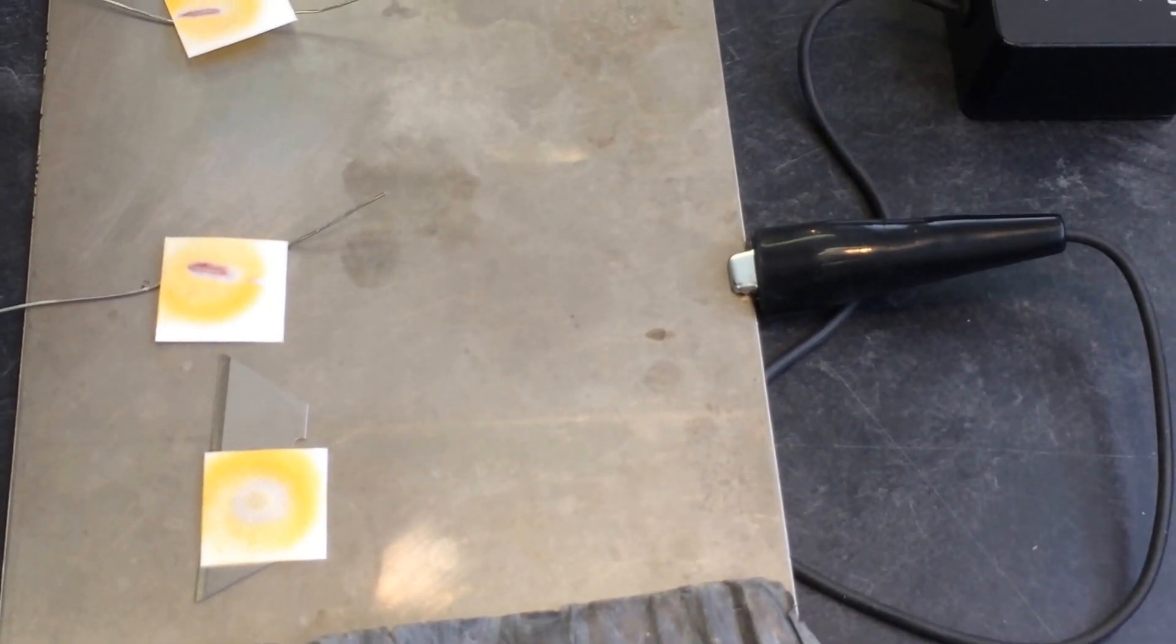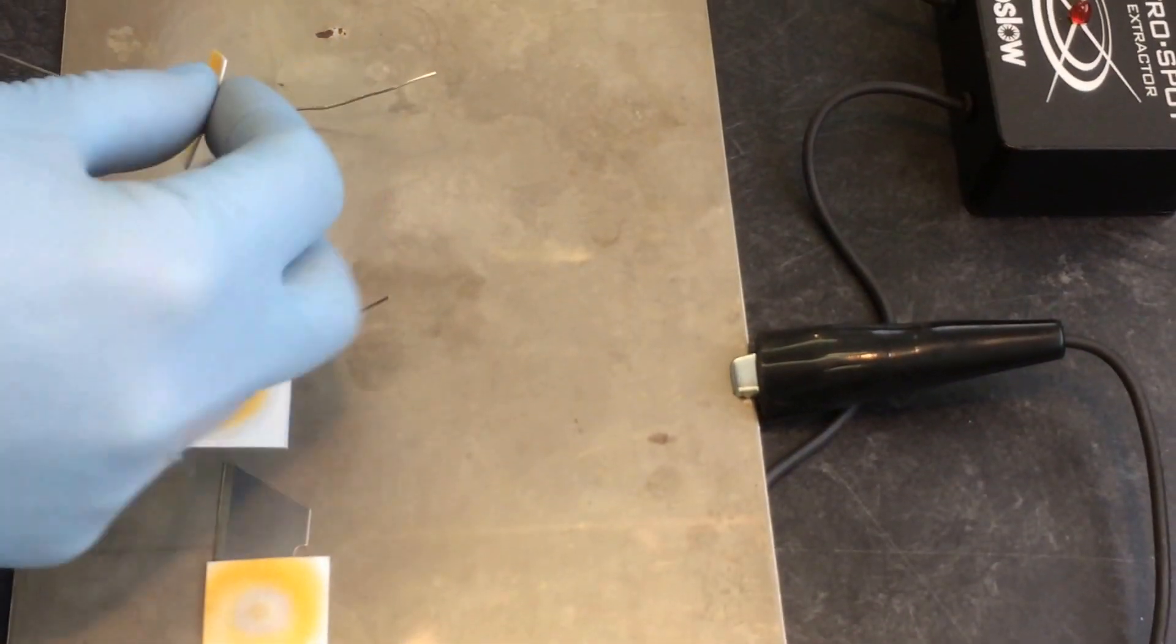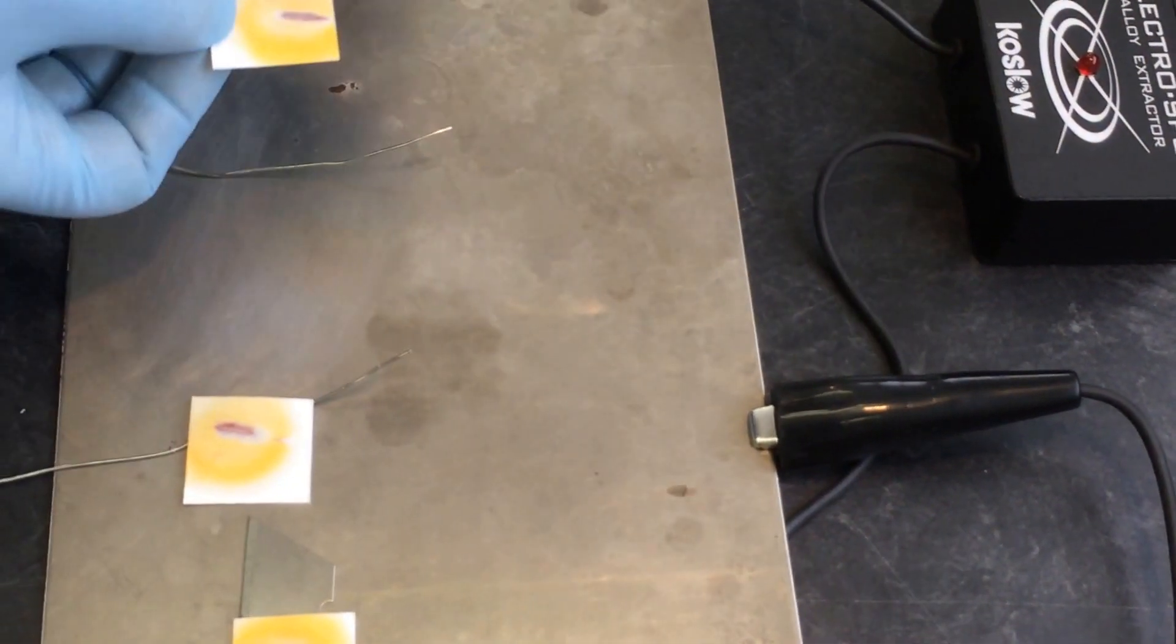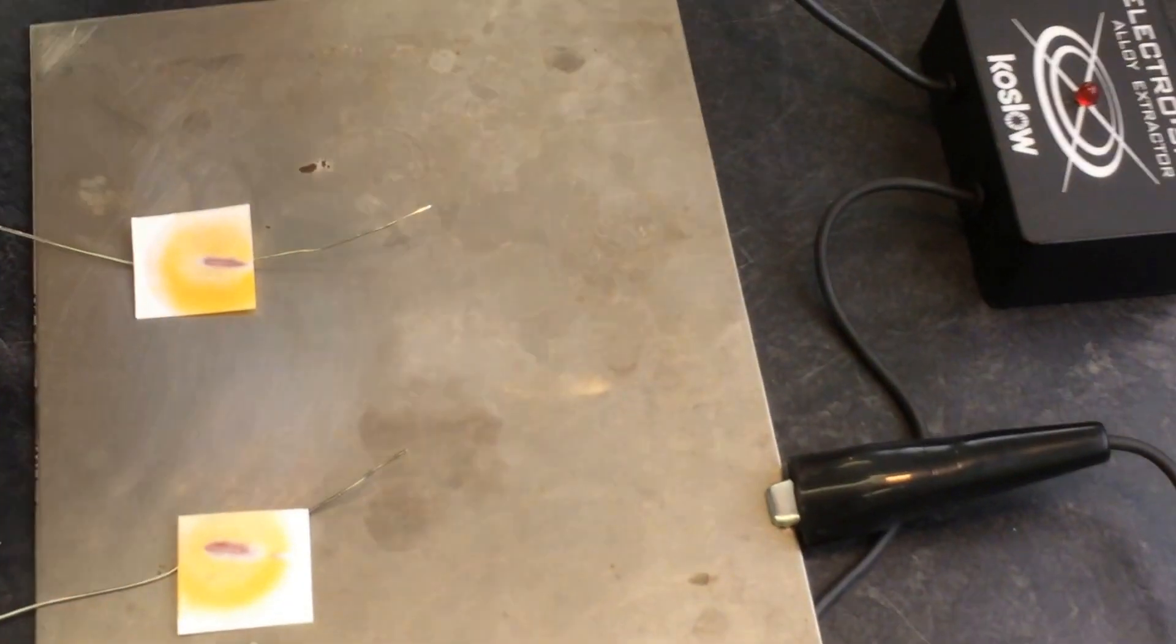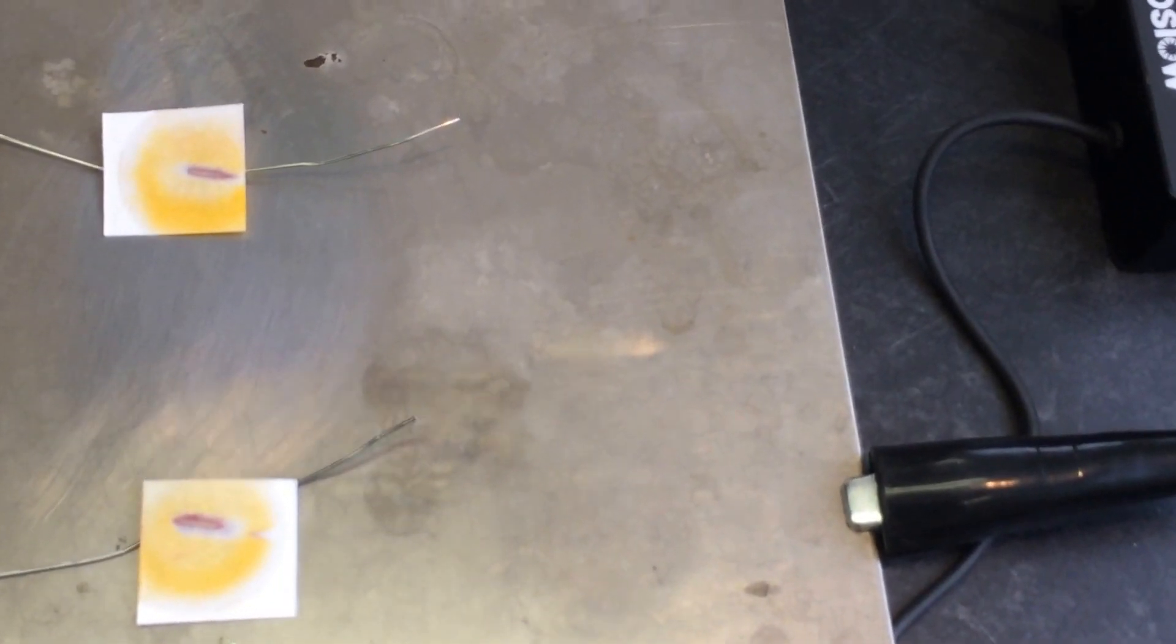And this is the lead free solder. And maybe you could see a trace amount of red, but it's barely perceptible.